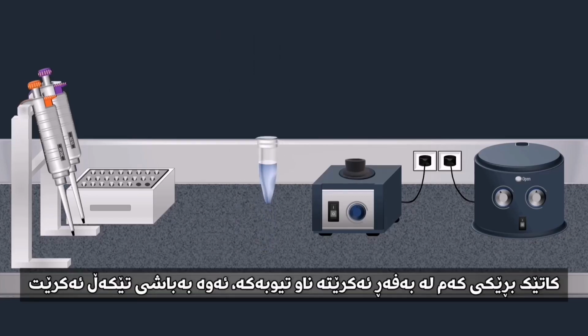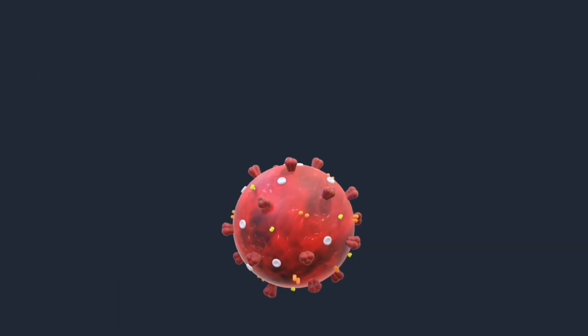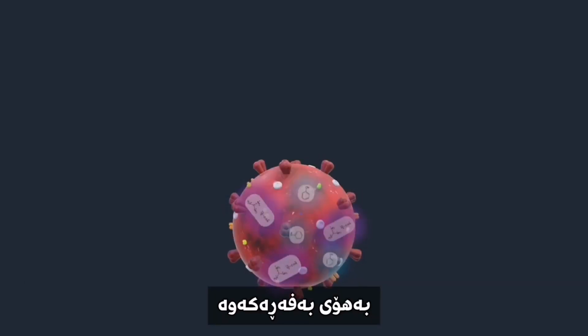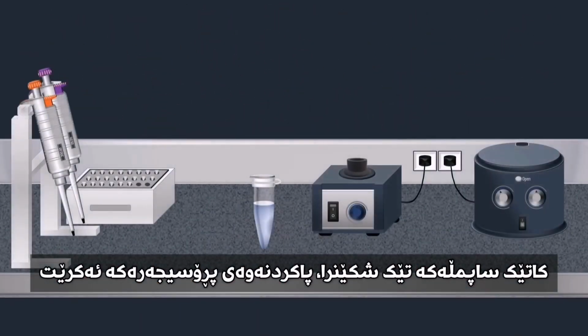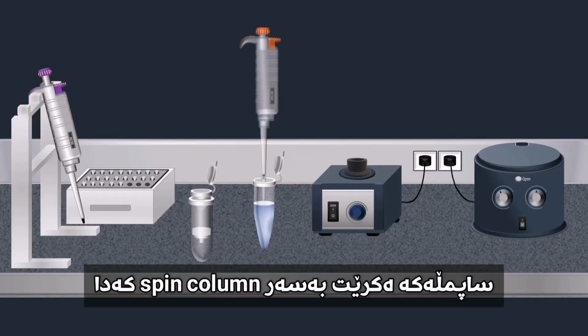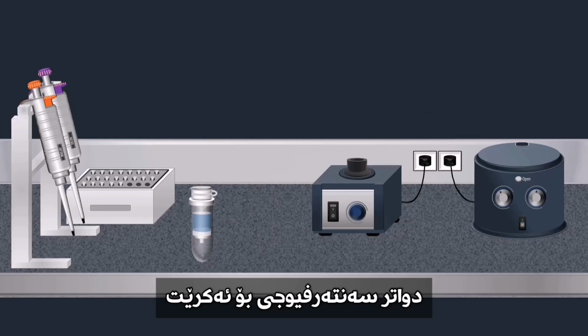Once the lysis buffer is added, the tube is mixed by pulse vortexing and incubated at room temperature. Then the virus is lysed under the highly denaturing conditions provided by the lysis buffer. Once the sample is lysed, a purification procedure is carried out using a spin column. The sample is loaded onto the spin column. Then centrifugation is performed.